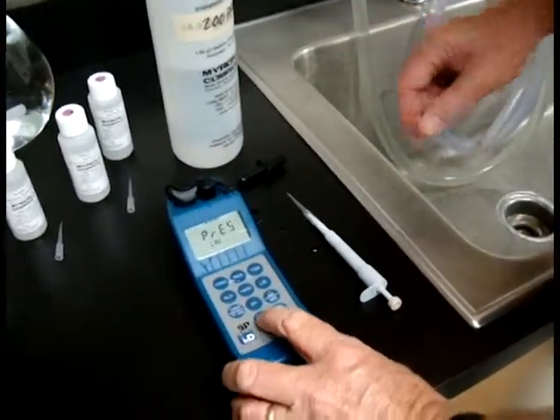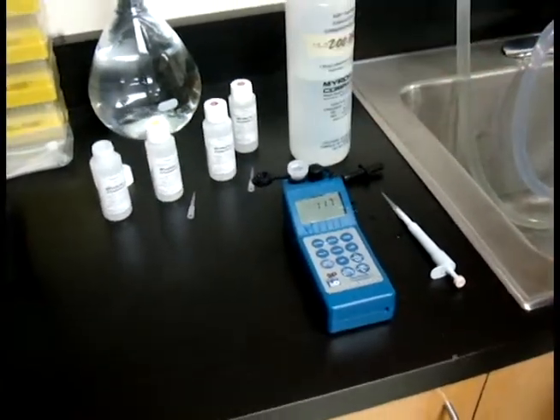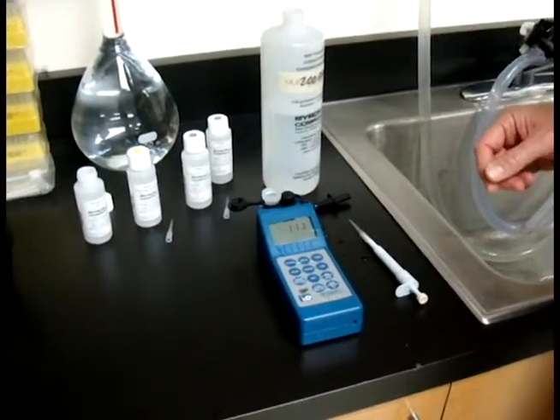Press Cal and open that cap. What's happening now is the CO2 is bubbling off — we're getting rid of the CO2 that way. That gives us 120 seconds to basically get ready for the next titration.